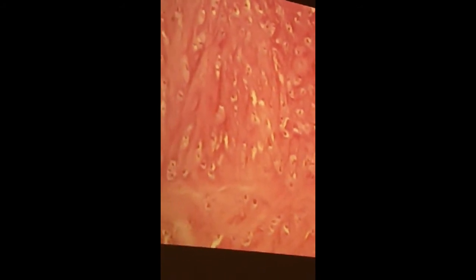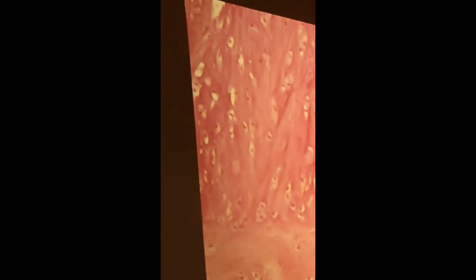So you want to go to the top of the slide and shut your aperture diaphragm down, and you're going to be able to see the collagen fibers there, and that tells you that you're looking at fibrocartilage. If you shut your aperture diaphragm down and look at the region where there's hyaline cartilage, because there's active endochondral ossification going on in that slide, you're going to see that the matrix of hyaline cartilage isn't refractile because you don't have type 1 collagen fibers.